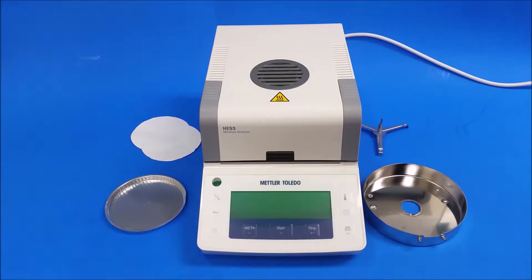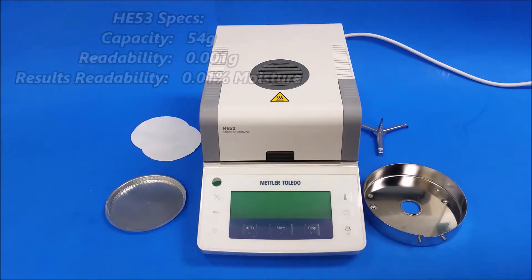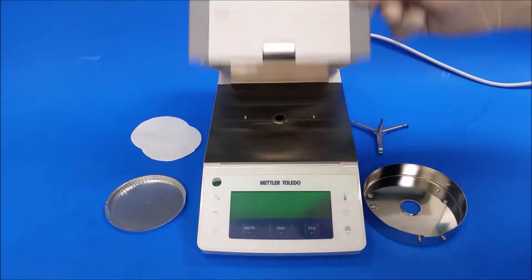Hello everybody, DSC guy here. Today I'm going to show you how to run a test on your Mettler Toledo HE53 moisture analyzer. First thing I'm going to do is put in its original parts, so first open the hood.